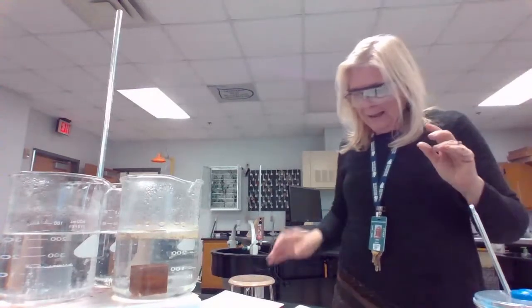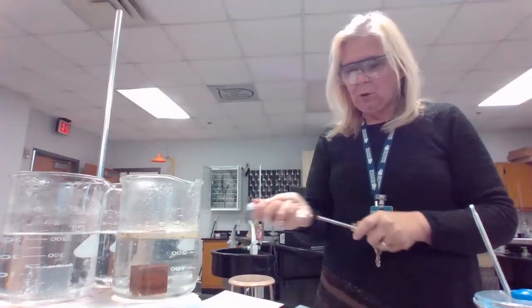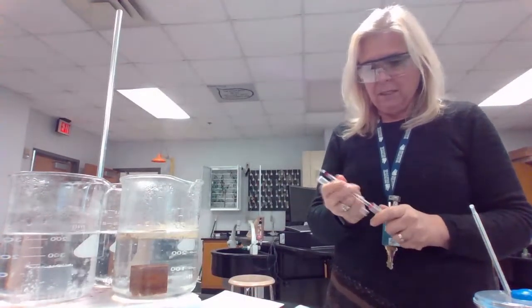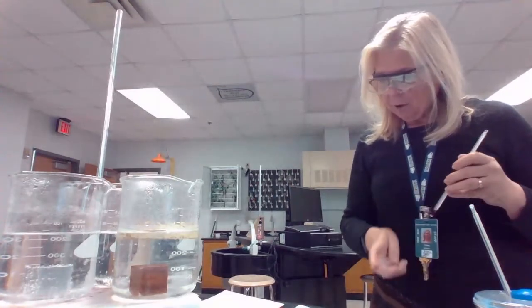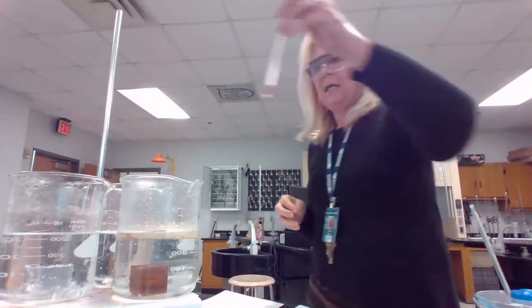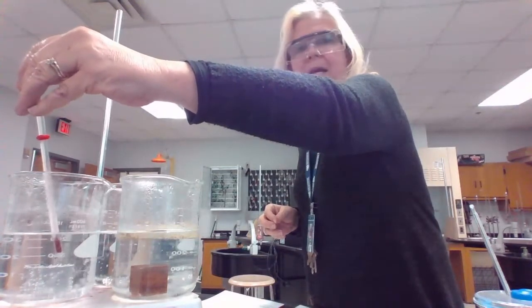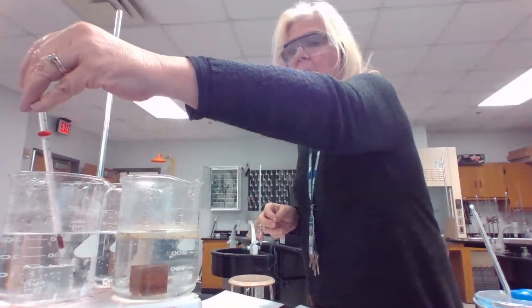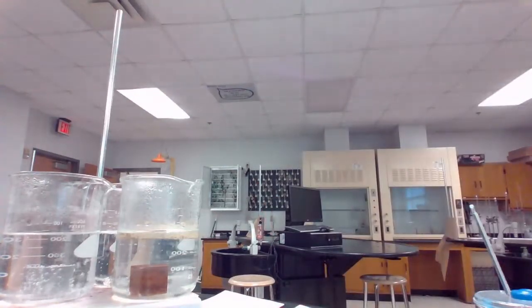And so while we're allowing the metals to heat, we're going to take the temperature so we know when to stop, because the directions say to heat them until the temperature is above 90. Right now I'm going to take the temperature of my aluminum. Actually, I'm going to do this with the temperature probe, because that makes so much more sense and goes so much more quickly.